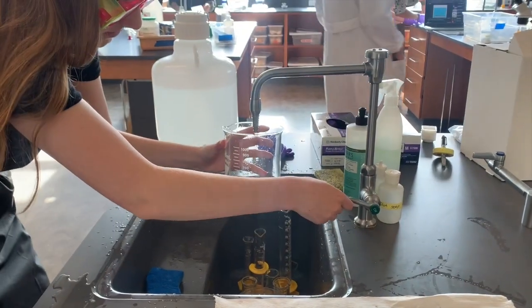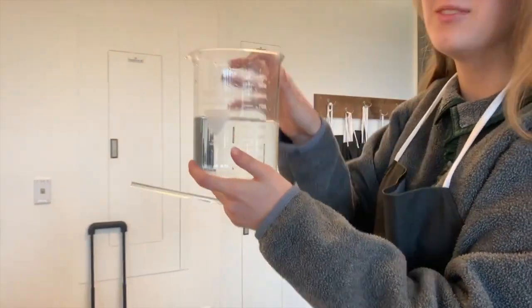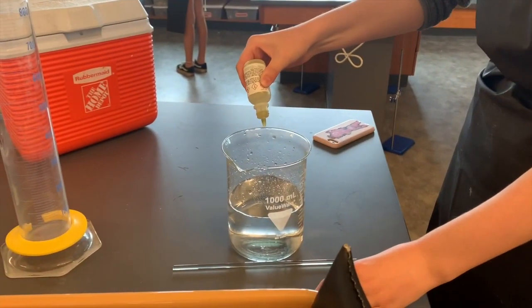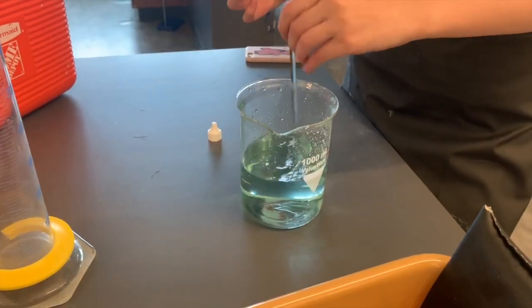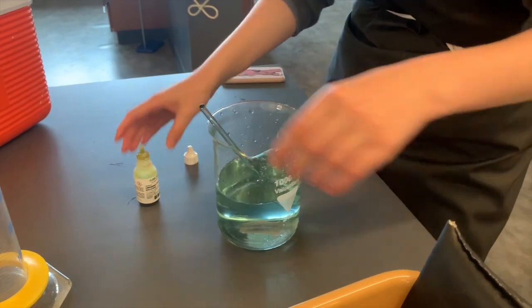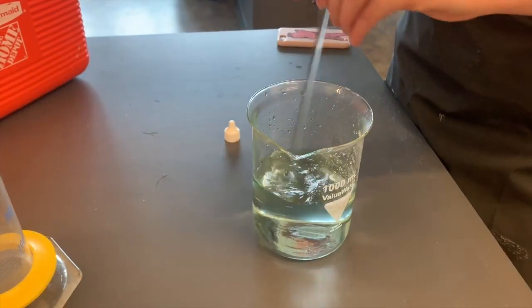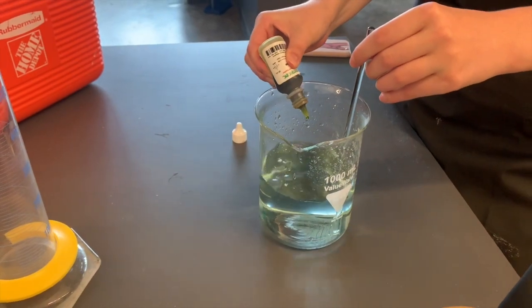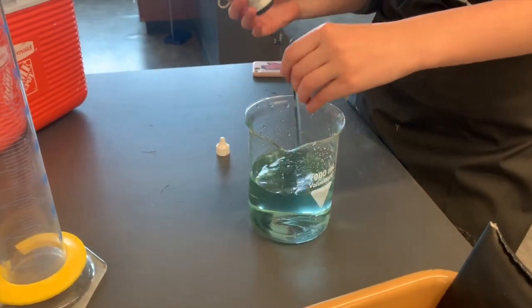To begin, we will add warm water to a beaker, which Eliza will now model for you. We will then add about 10 drops of universal indicator. You're probably wondering, what is universal indicator? Well, it's a mix of a lot of different things that change color to show a thing called pH, which we'll get into later. When the universal indicator touches different types of materials, it will produce a certain color.